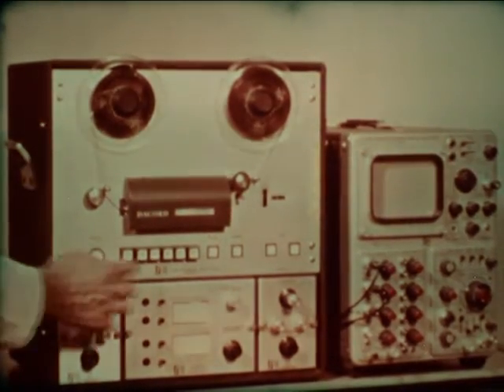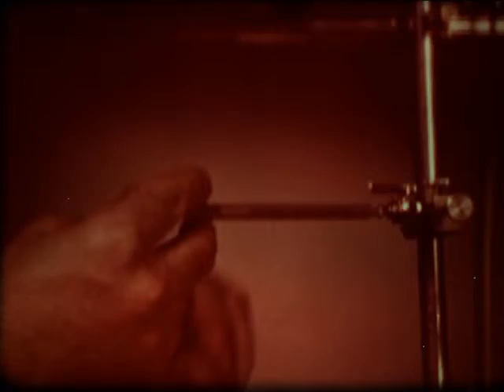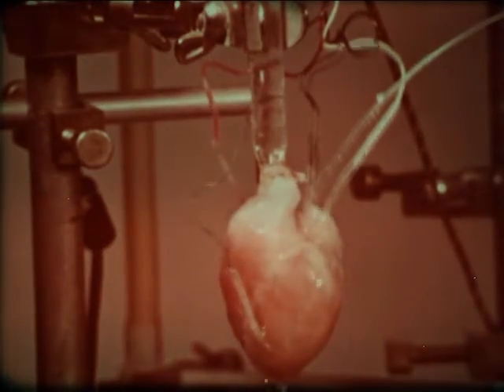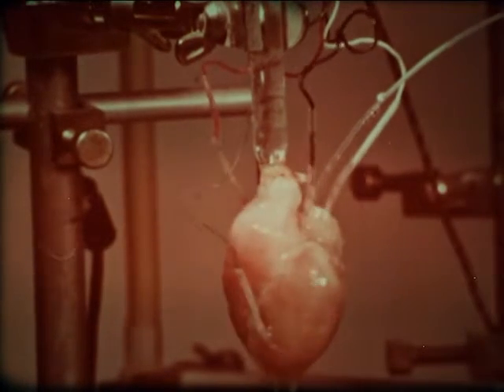The electrogram and ventricular pressure recorded on magnetic tape are played into a storage oscilloscope. Norepinephrine injected into the spontaneously beating heart induces tachycardia, a positive chronotropic effect, and an increase in contractile force, a positive inotropic effect. At a slow sweep speed, the progressive change in intraventricular pressure is shown. Norepinephrine is seen to exert a positive chronotropic and a positive inotropic effect.